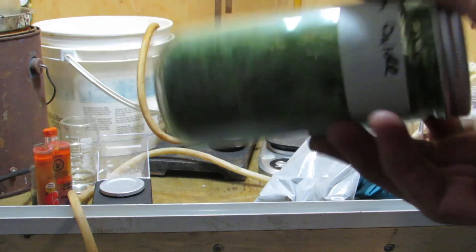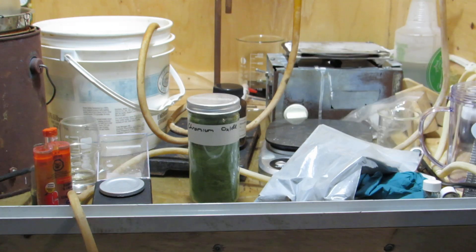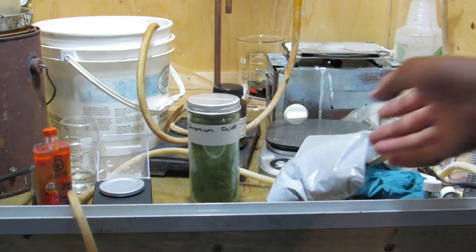Chromium oxide can be purchased as a pigment for pottery from pottery supply stores and I show how to make aluminum powder from aluminum foil in a previous video.